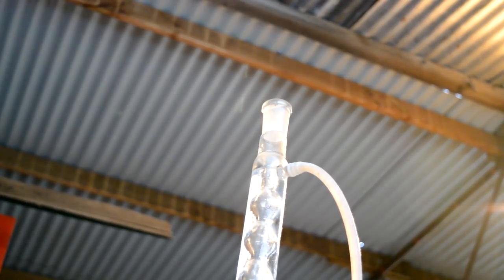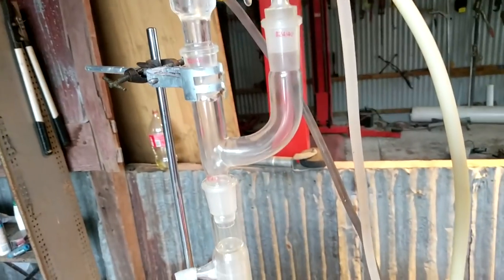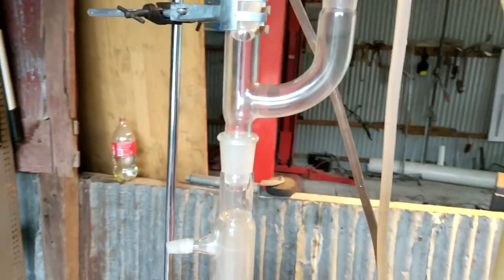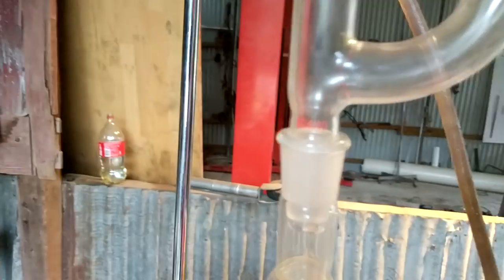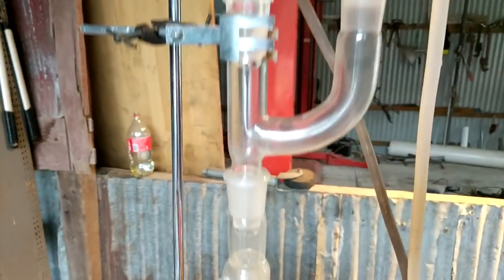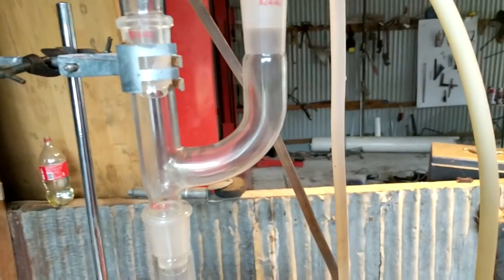Every so often, see a little whisk of smoke come out the top of the condenser, which is promising on a few fronts, but also the fact that it kind of implies that at least all the gas is going through the system. It's not like just leaking out at some point. The smoke is good because we expect the sort of hydrochloric acid byproduct to be a bit mist-like, I guess, but still not much happening. We're only 10 minutes in, so we've got a lot of system to flush out.